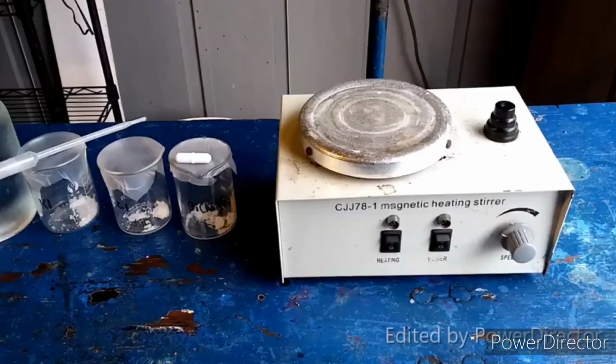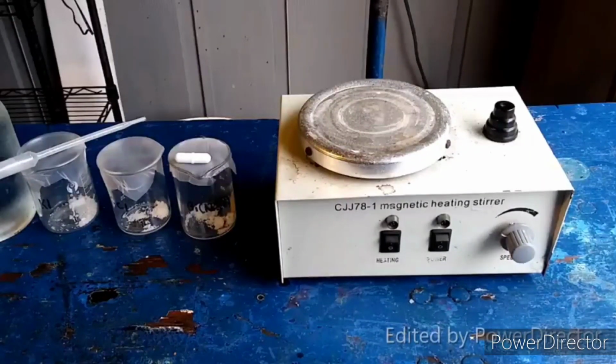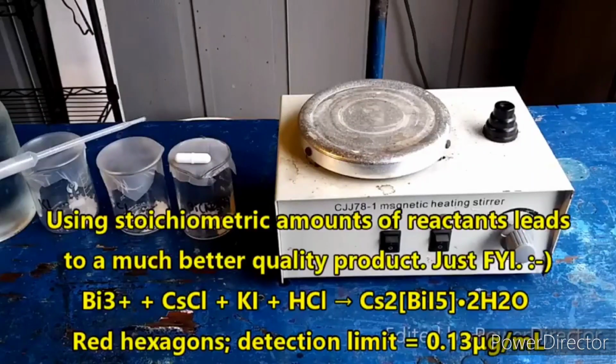I am going to make one thing from this list, which is technically dicesium pentaiodobismuthate(III). I fooled around with this reaction a couple of times. I've tinkered with it. If you just kind of throw everything together, you get a red solid like you are supposed to. I'm not going to be quite so haphazard in this video, though. I'm going to use the proper stoichiometry to get this.